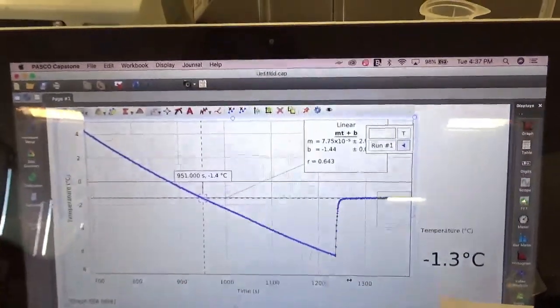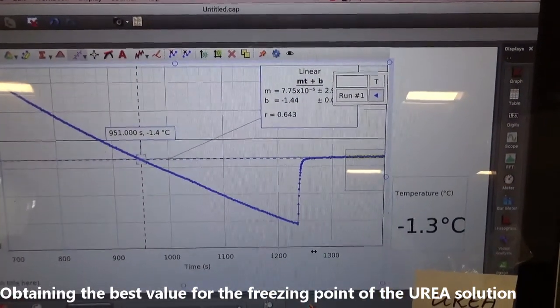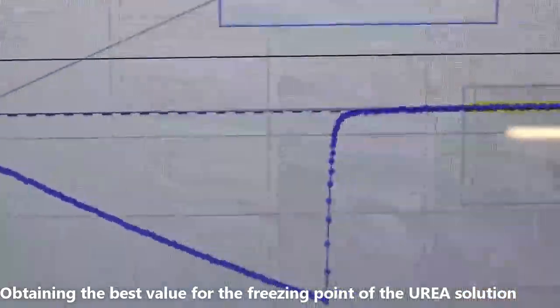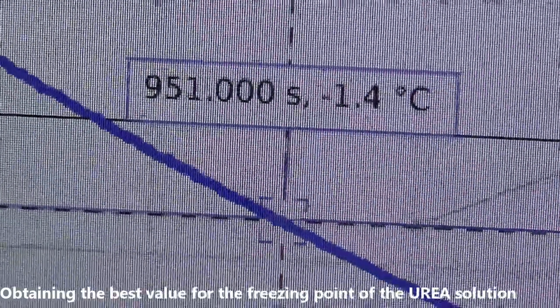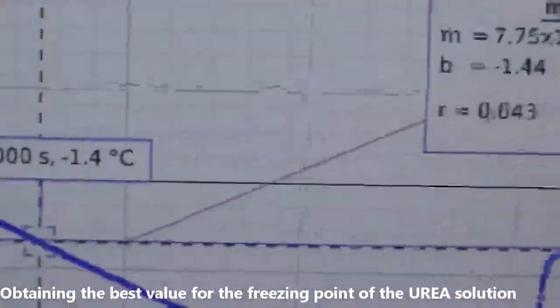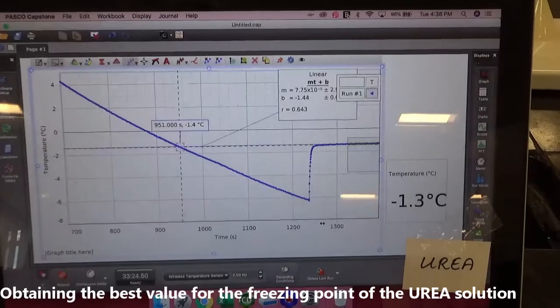Okay, so here is a closer up job. I expanded the scale so we could do this a little more precisely. And I extrapolated that line back. This is a close-up of it. And it looks like it's more like negative 1.4 degrees C. I'm going to go with that because this was done with a nice close-up. This is, again, the urea experiment.